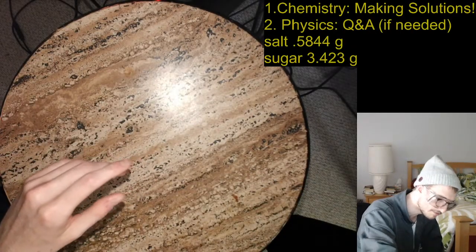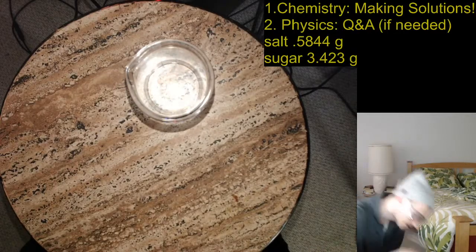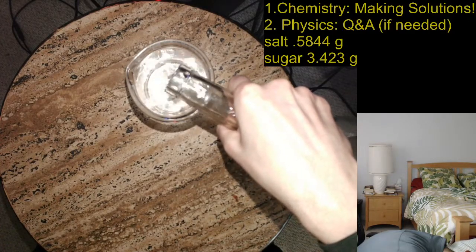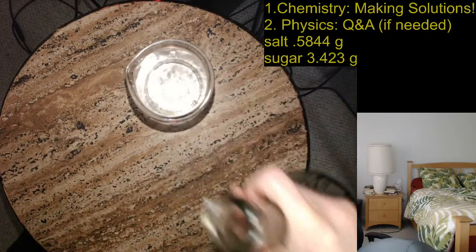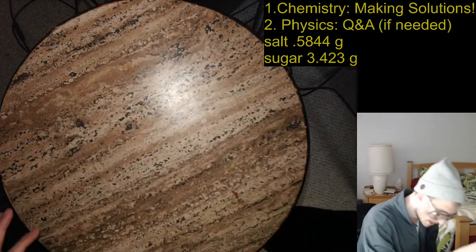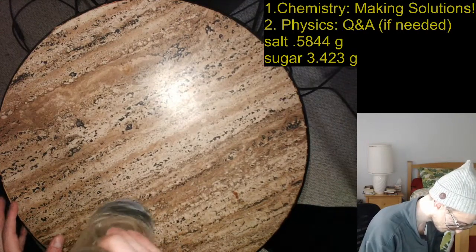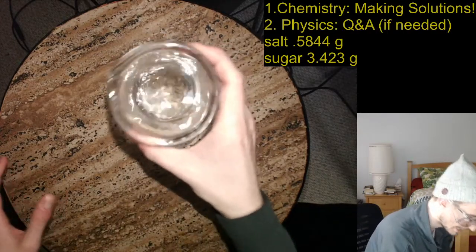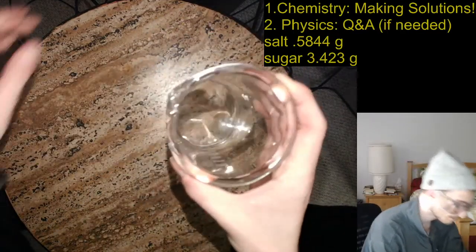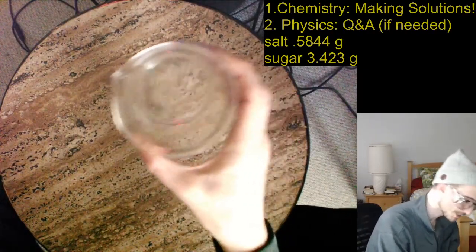So what I'm going to do is very carefully add solution until I get up to the 100 milliliter mark. Very carefully. Now, this is not all that careful because this is just a beaker as opposed to some kind of volumetric flask. But I've got it to 100 milliliters, and maybe that extra water will help me dissolve the last bit of salt or sugar. And it looks like it's done it. So from my perspective, this thing seems pretty clear. Wait, the lamp's still on. Oh, that was the problem, the lamp was still on.